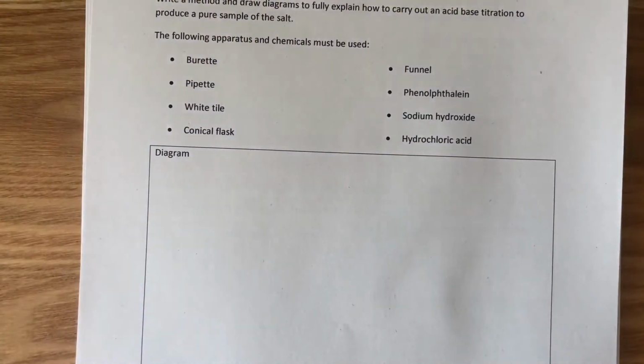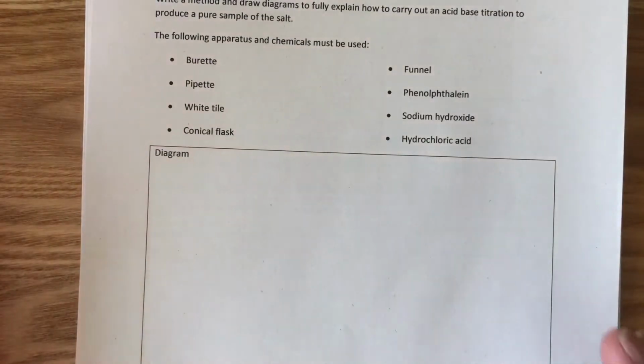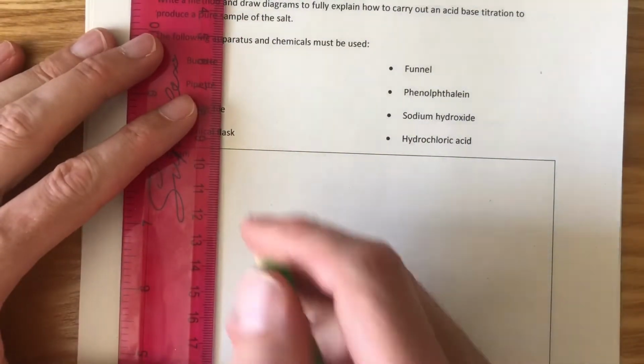Now, if you're a triple chemist and you are going to do the single chemistry GCSE, in the extension unit, the triple chemistry unit, we do study titrations in more depth, and there is a video of me carrying out a titration that you can watch about this. I'm just going to talk through the apparatus in this, and not show you the apparatus because we'll look at that later on. So the apparatus we need, first and foremost, is a burette.